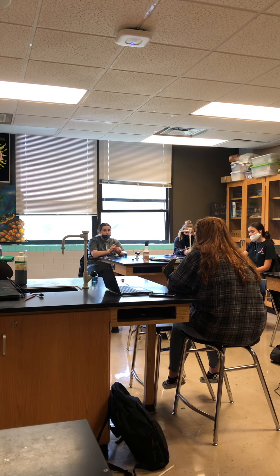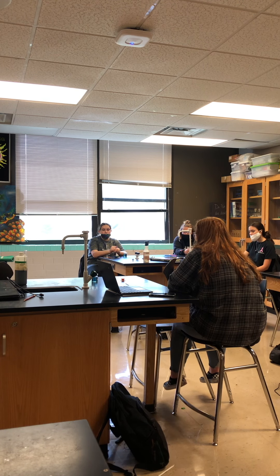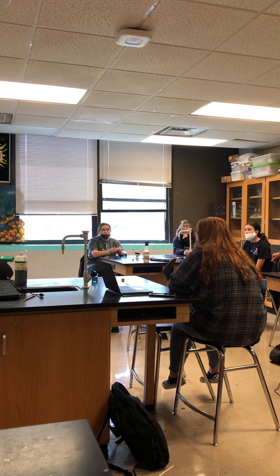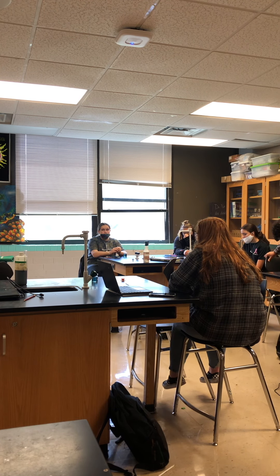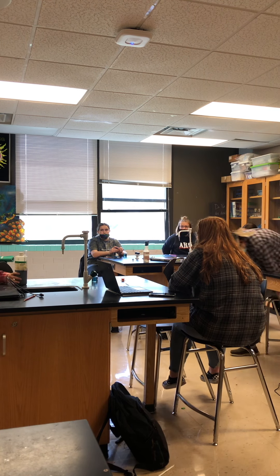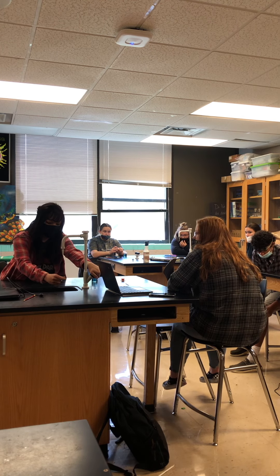It doesn't show bases. On the pH scale we've got acids and bases, but this is only an acid indicator. So that told me there was something in that beaker before we used it today that was acidic — it was probably the apple or grape juice we used in the lab a while back.